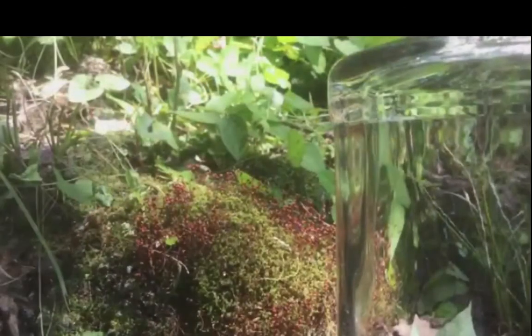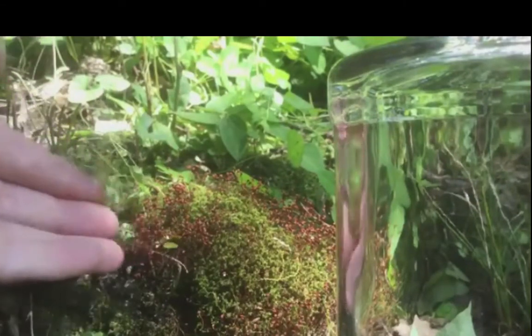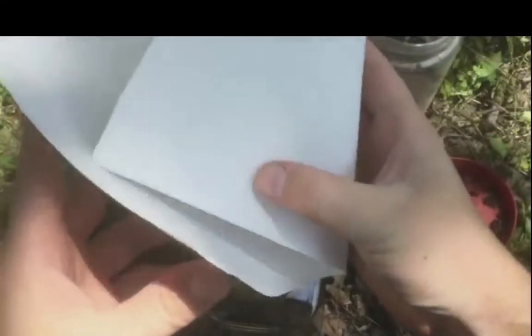This is going to be a native terrarium, using mosses that we've collected right here in the backyard. We could probably use native soil, but I want our soil to be nice and clean, so that if any moss sprouts, I know it was from our spores. So I'm going to be using just my normal potting soil from indoors. That way I know it's nice and sterile. And so we don't make too much of a mess, I'm going to take a little piece of paper and make a funnel.